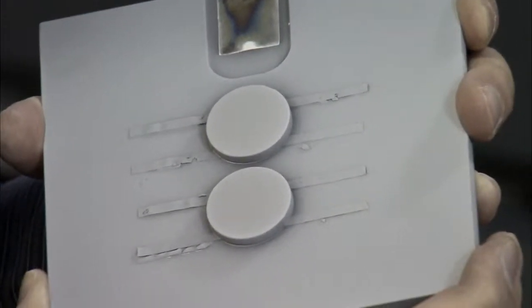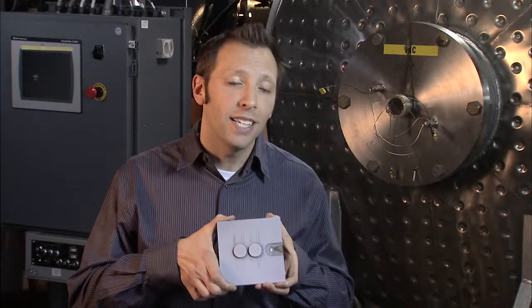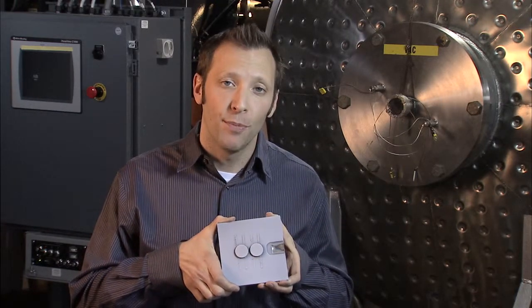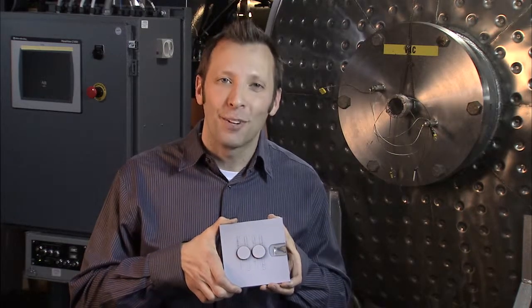So after the deposition is complete, we're left with a nice thin layer of ceramic on our samples. These can now be removed from the plate and submitted for testing. Thanks for stopping by.